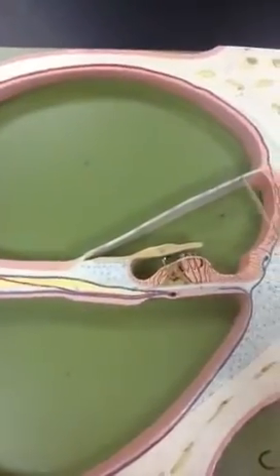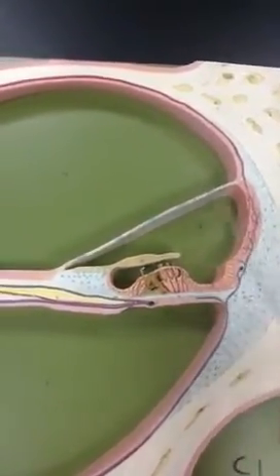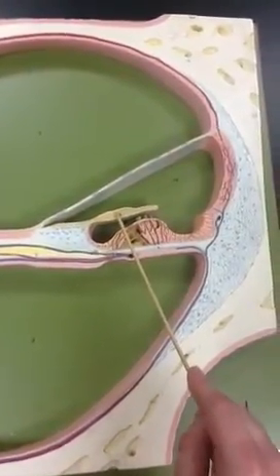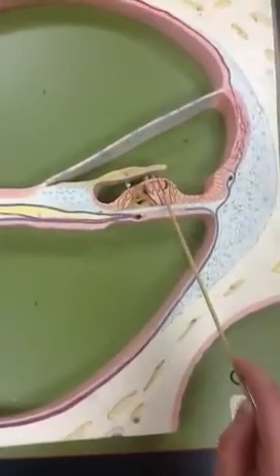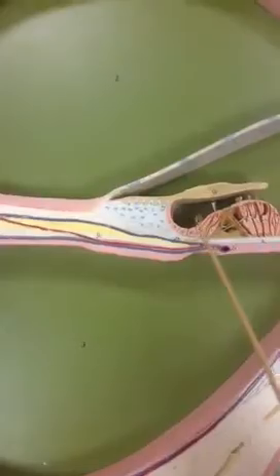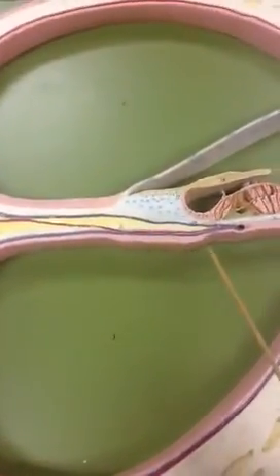This shelf is called the vestibular membrane. This is the tectorial membrane. And these are the outer hair cells. And on this side we have the inner hair cells. This is the basilar membrane.